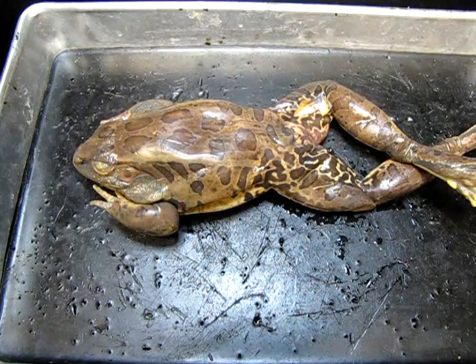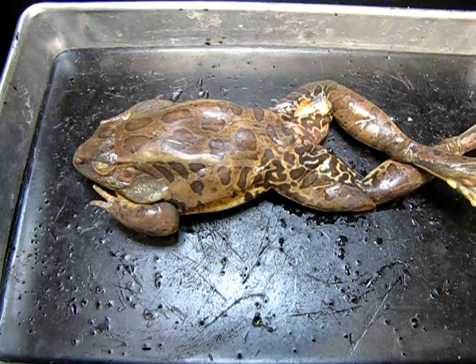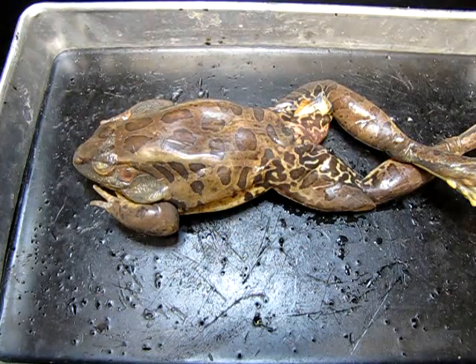This is a grass frog. The grass frog is in the phylum Chordata and the class Amphibia, which makes it an amphibian.